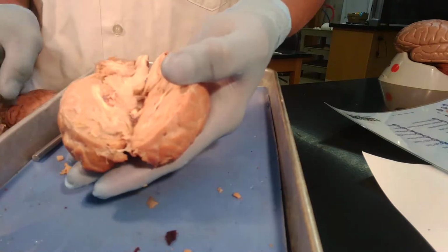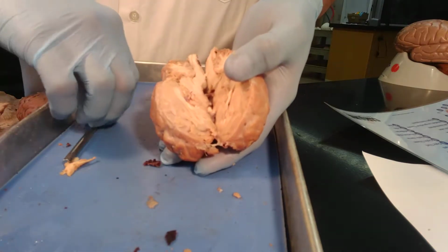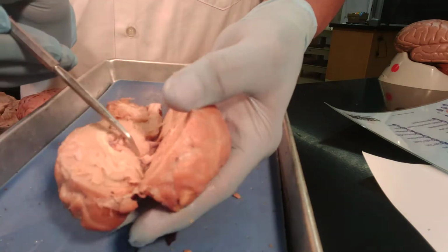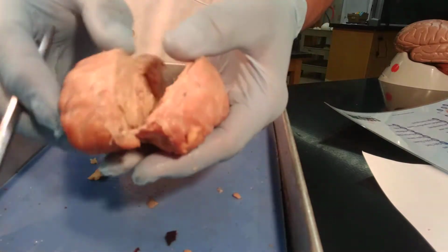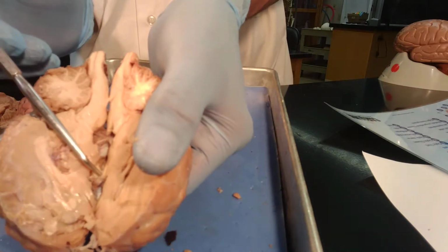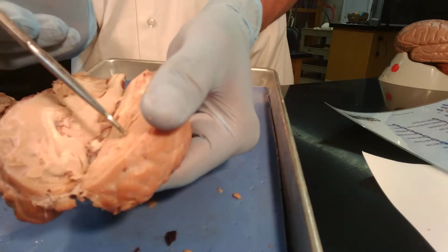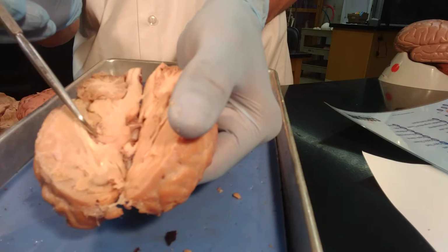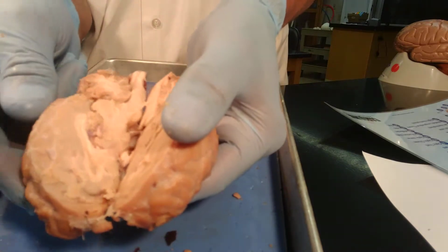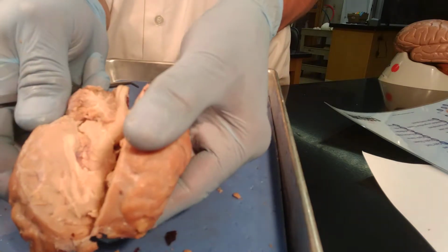I'm going to show you the part that I can look at here and compare with what we have. So here you're looking at the two hemispheres. This is our optic chiasma. You see here? Optic chiasma right in the middle, connecting the two brains. This is our corpus callosum. It is that fibrous tissue holding the two hemispheres together. If I put them back in there, that's what you see, beginning to split the two corpus callosum.